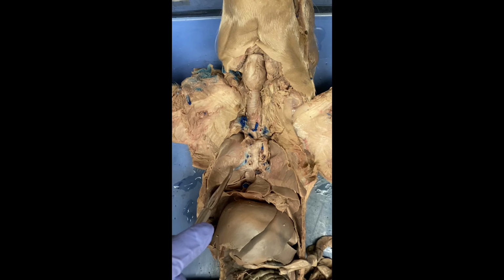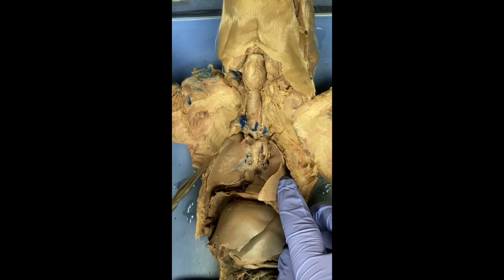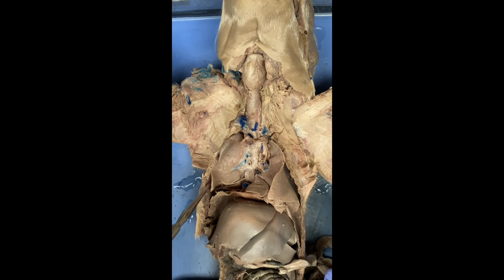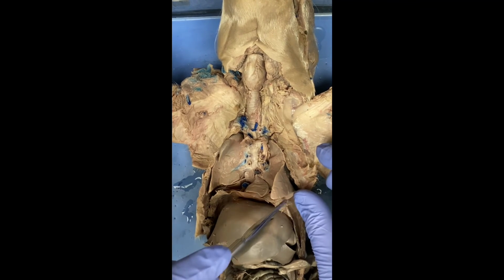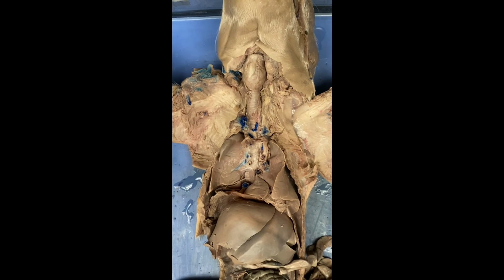Next we have the lungs, which is probably the first thing that comes to mind when you think about the respiratory system. This is where gas exchange actually occurs. We have multiple lobes, here and here. There's even some smaller ones that go down into here. So lots of little lobes of the lung.